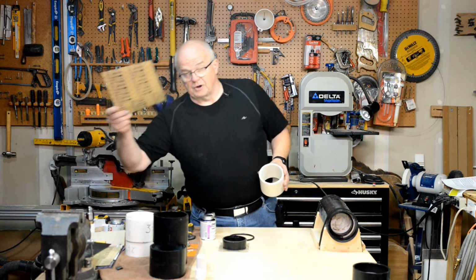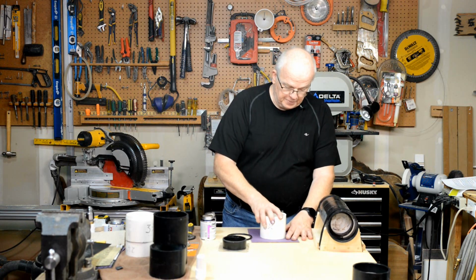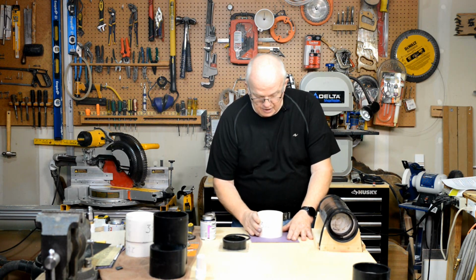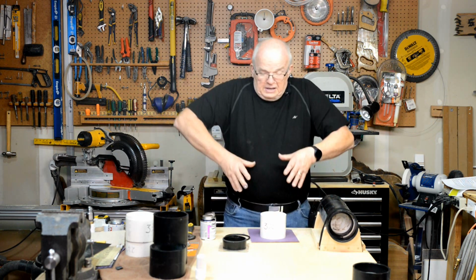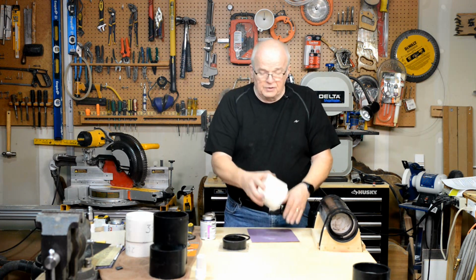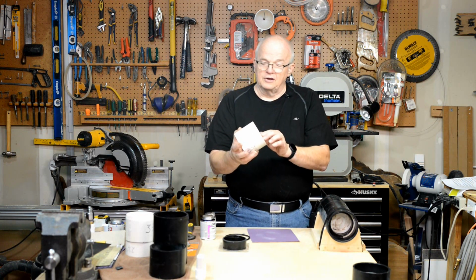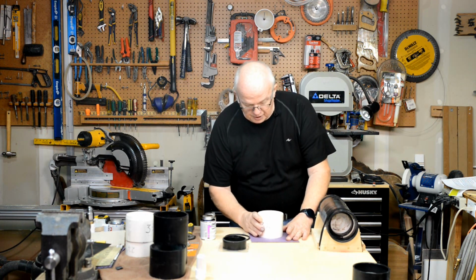careful. I'm starting with some 220 grit sandpaper, and I'll put this on here, and I'll just move it around a little bit, very, very lightly. It doesn't take a lot. And don't lean down on it, for heaven's sakes. You want this to stay square and you want it to stay smooth. See, that little anomaly that I had on there is already practically completely gone.